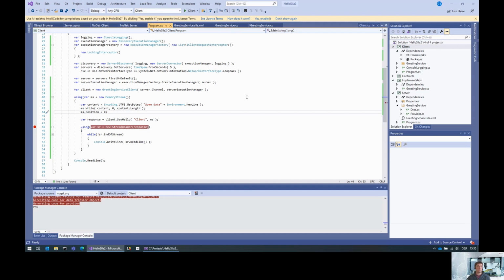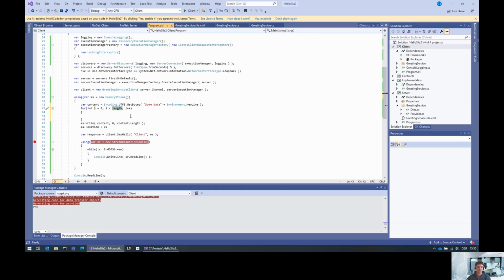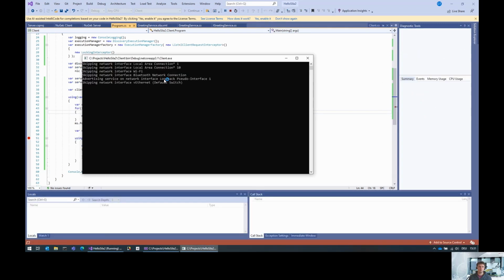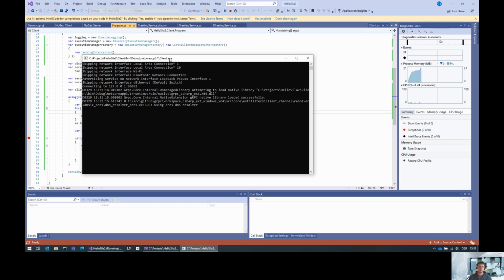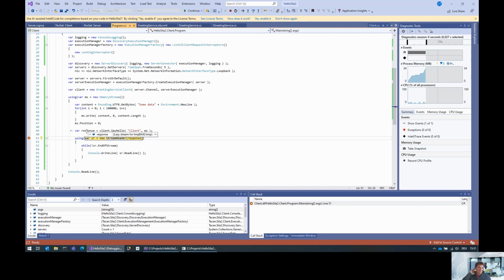So, okay, what if we go larger? We can, for instance, just do a for loop and add this some data like 100,000 times. And if we execute the client now, we also get a response, but this time the response is actually a lazy stream for some temporary file.